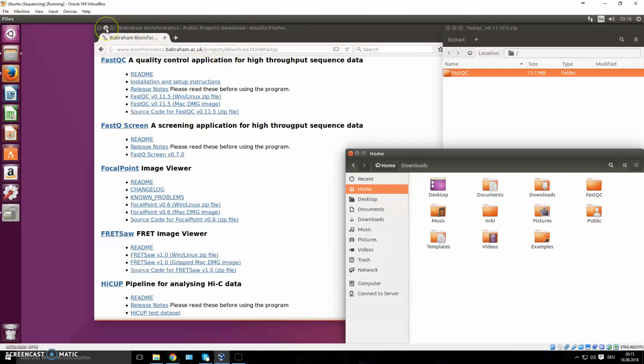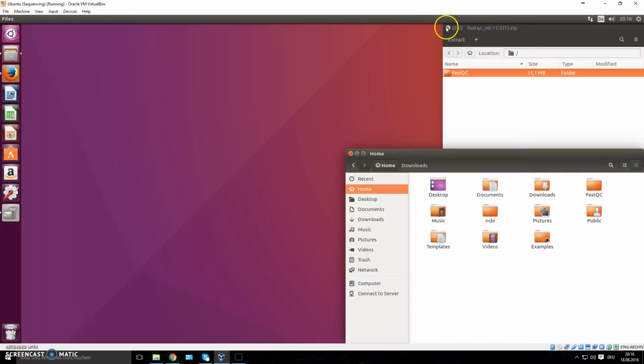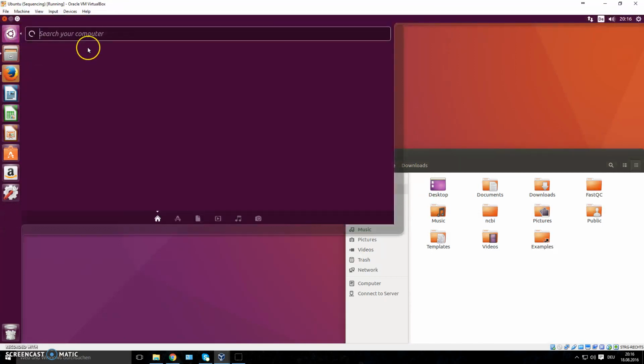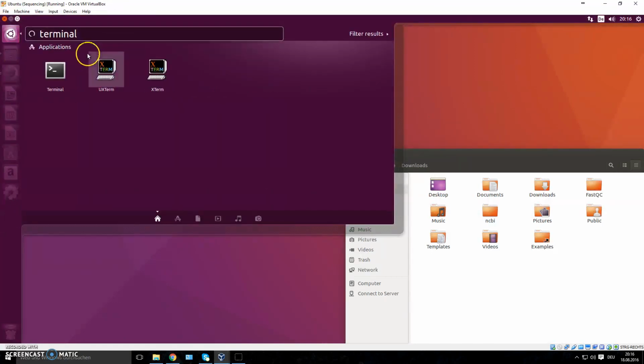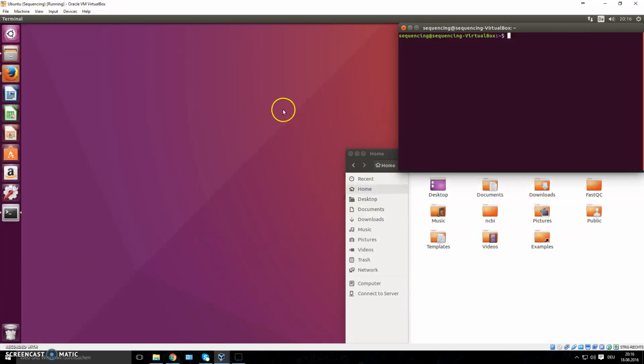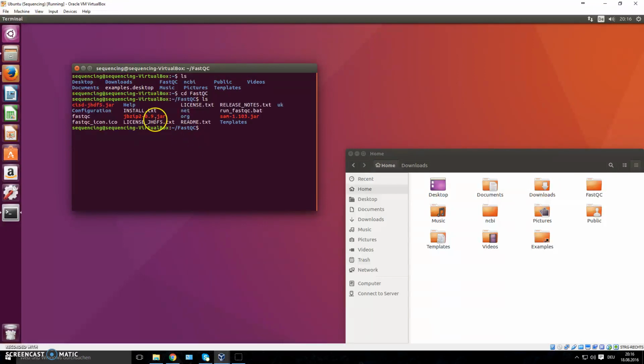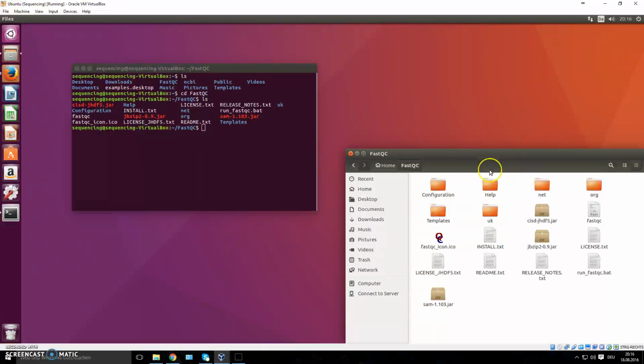Now, if you want to start it up, I'm just going to minimize this and close this and open up a terminal. You can open up the terminal as discussed either here just by typing terminal or Ctrl Alt T. And we type ls to see the different folders and files here. And we see here the FastQC folder right there. We change the directory into that folder. Write ls again, and you see these are the contents here.